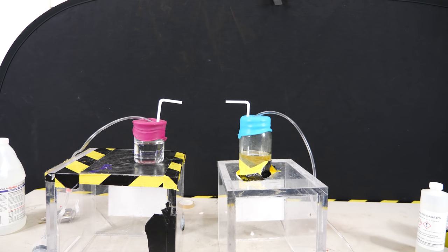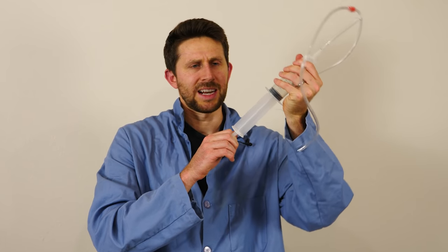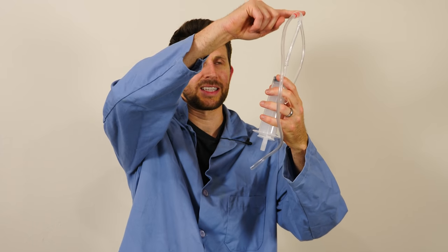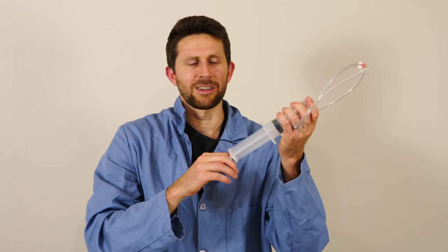So what I'm going to be sticking in these is a syringe with two one-way valves on them. So it'll suck air through one side and blow it out the other side. So it sucks in this side and blows it out this side. So what I can do is I can blow air through these solutions.